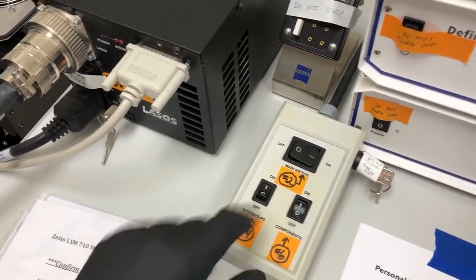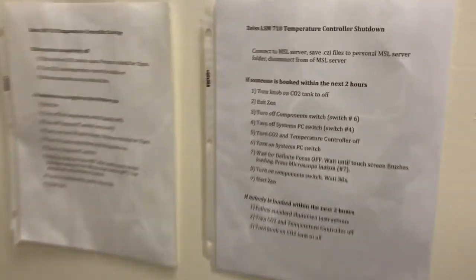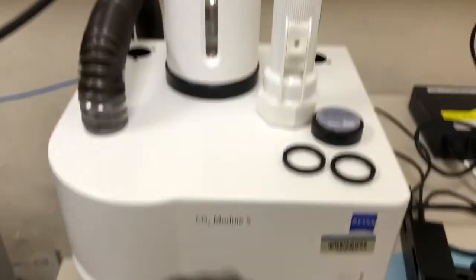Turn off the component switch, switch number 6. Turn off the system's PC switch, number 4. Turn the CO2 and temperature controller off. Remember, that's the switch that's back here. So, right there. You can see the lights are off on that.